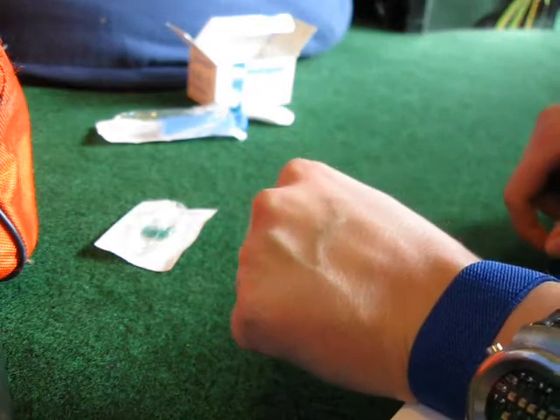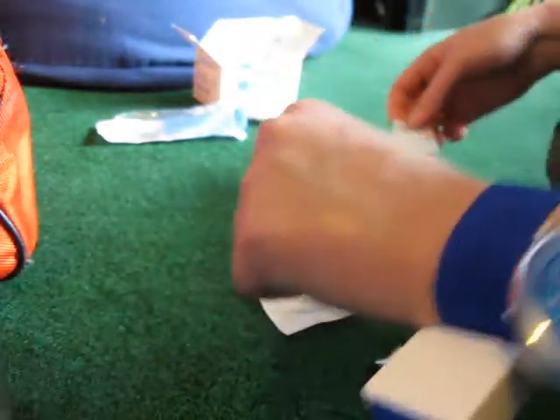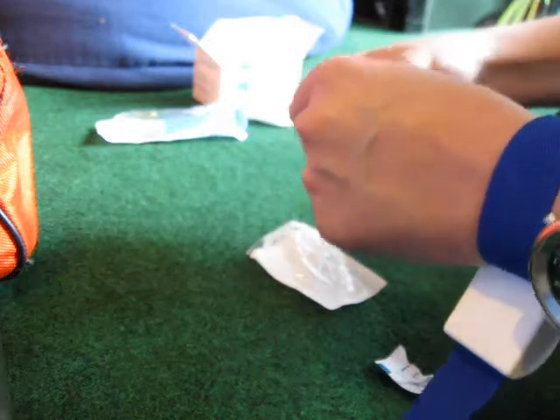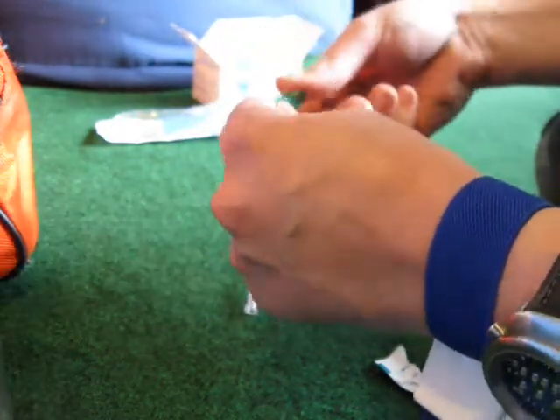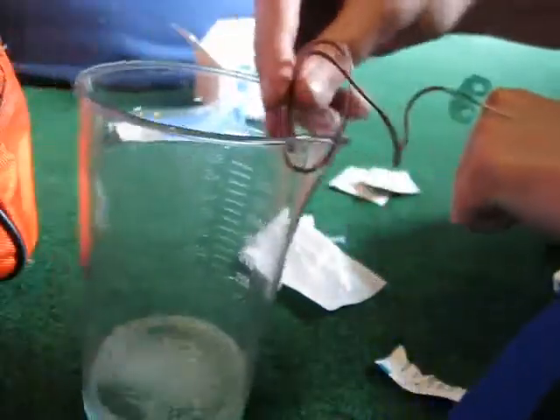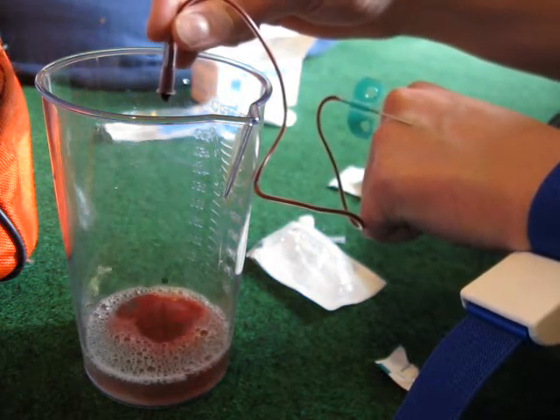You can see a vein sticking out there. I'm just going to let it drop into the solution. That's not for the faint of heart I suppose, but it works.